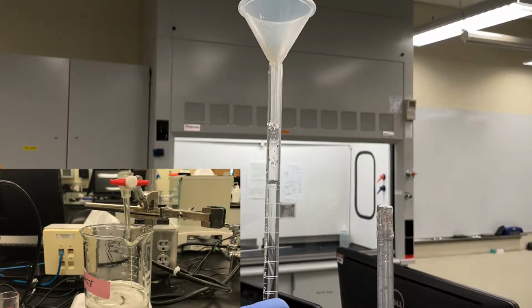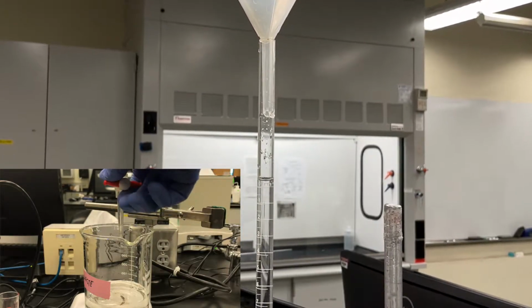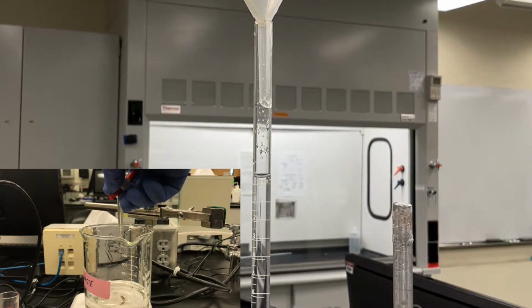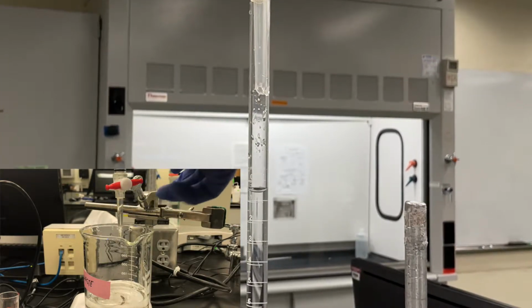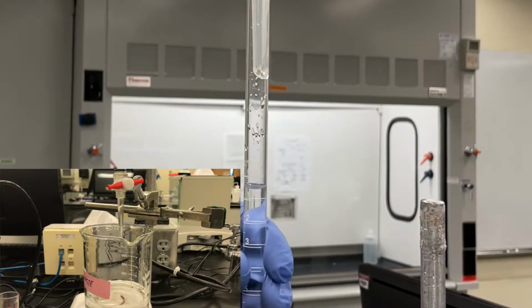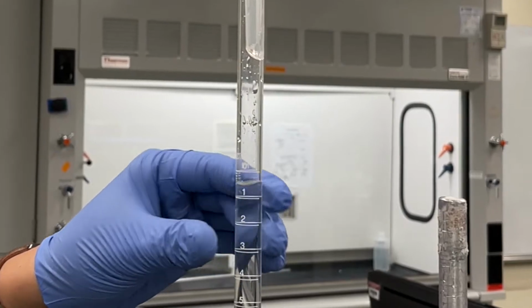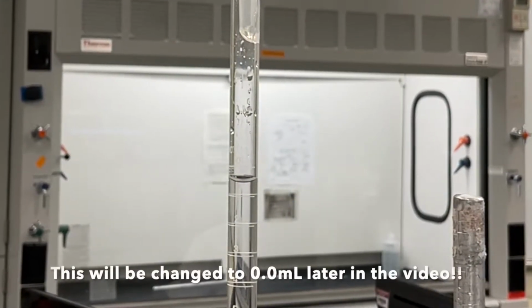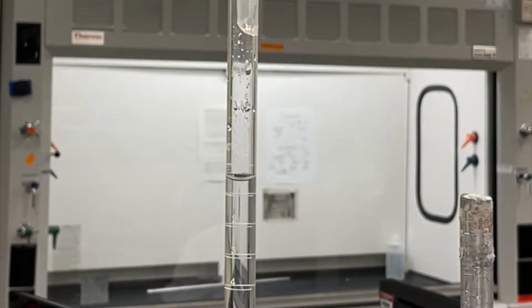Putting our burette back onto the ring stand, we'll slowly open our stopcock to release the sodium hydroxide into the end right here. This is full, and now we can start our titration with the meniscus showing at 0.5 milliliters. That'll be our initial starting point.